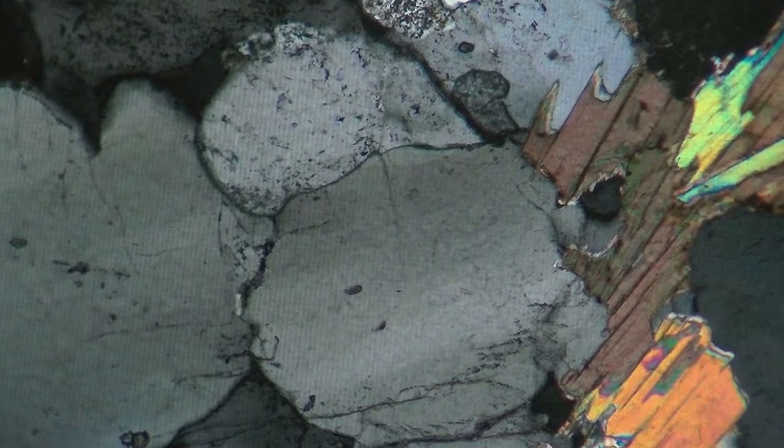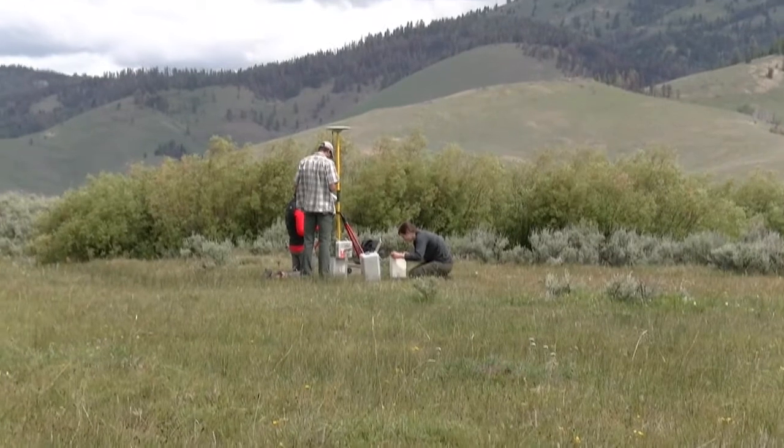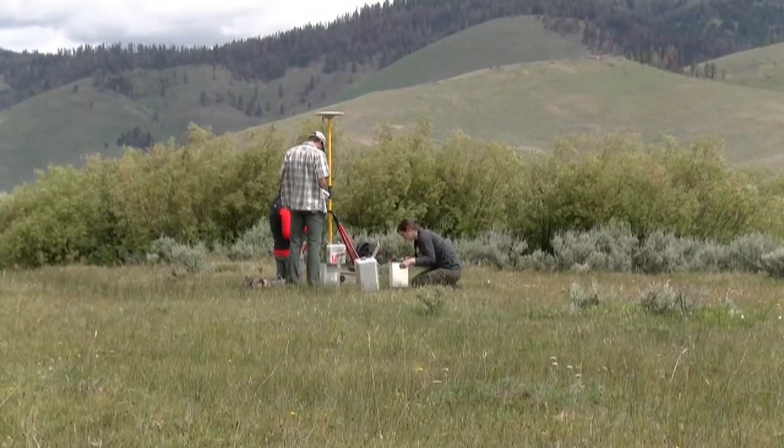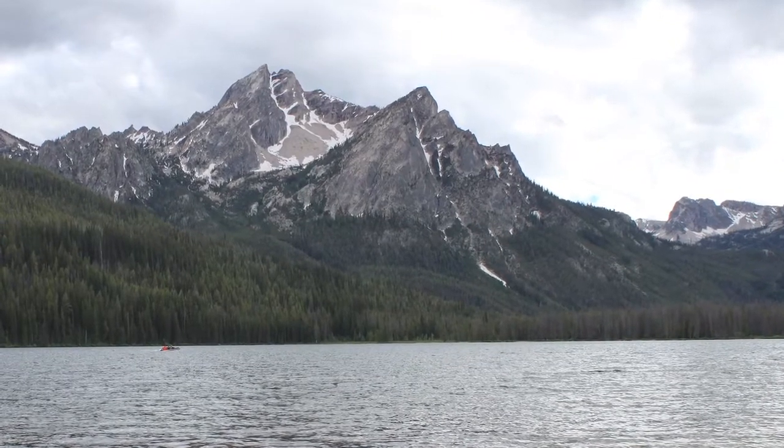Both the thin sections and the magnetic work tell us more about the three-dimensional geometry of the minerals within the rock from the specific field site that the rock was collected. The data that I collected in the field and in the lab will be used in combination with the geophysical work that our collaborators are doing to work on interpretations of the tectonic setting and the magmatism and the deformation that happened in Idaho beginning about 90 million years ago.